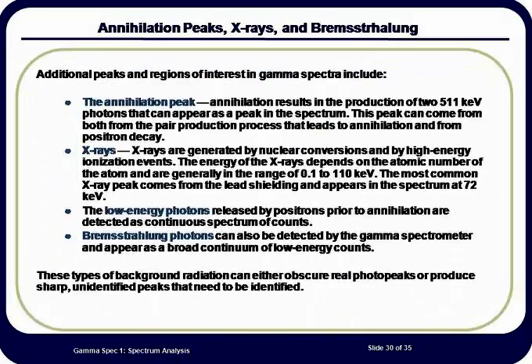When a gamma ray interacts with the lead shielding around the detector via the photoelectric effect, lead X-rays are produced. These X-rays can strike the detector, giving rise to a signal at about 72 keV. In the previous gamma ray spectrum for cobalt-60, the lead X-rays can be seen as a very small peak at the very low end of the energy range.